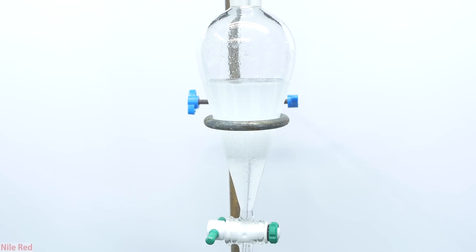I don't show it here, but I take the separatory funnel off the stand, cap it, shake it thoroughly with frequent venting, and then place it back on the stand for the layers to separate.